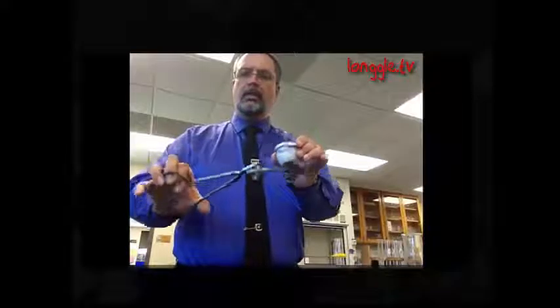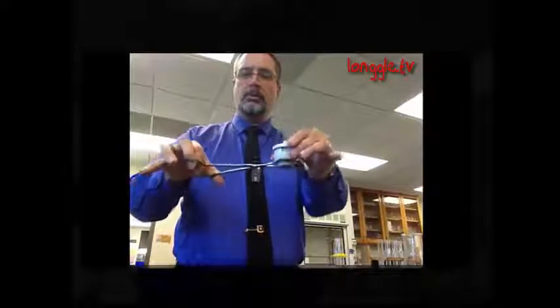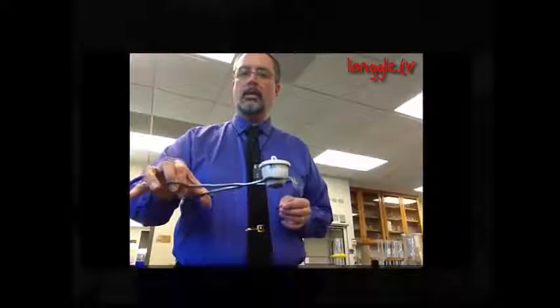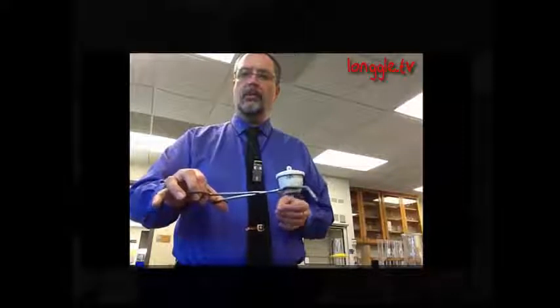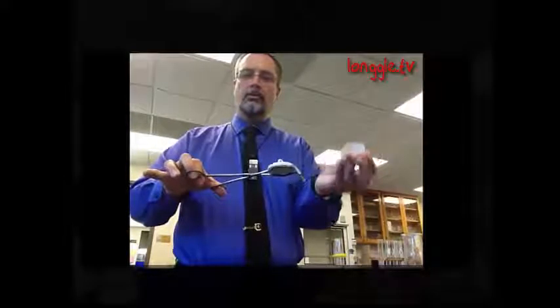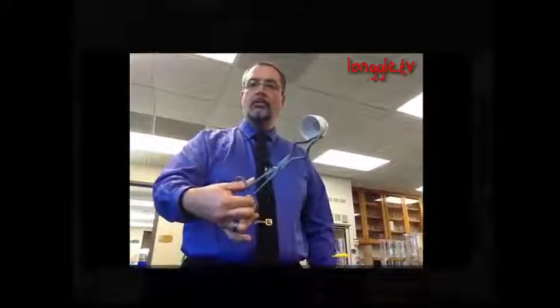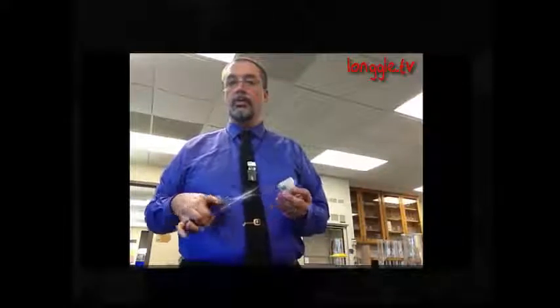And originally, this little weird bent piece in the middle of the crucible tongs was designed to allow the crucible to sit right in there. Unfortunately, if you don't have a steady grip or you relax your hand just a little bit, it'll slip right through and you'll break your crucible. So when we use crucibles, we don't carry the hat, the lid, around with it. We just grip it by the sides, and that thing's not going anywhere. It's very, very secure that way. So we can carry it around the lab. We don't want to be touching it with our hands because it's usually going to be very hot. So we can carry it around with the crucible tongs. Pretty easy.